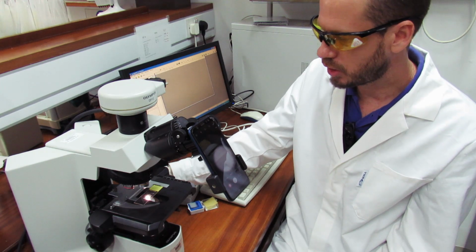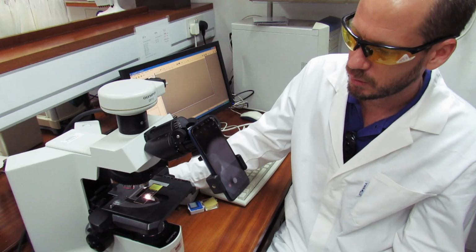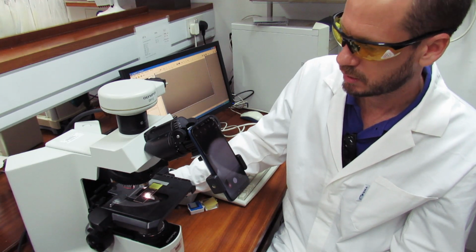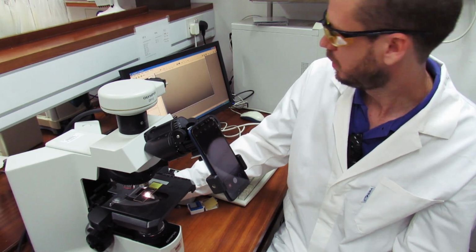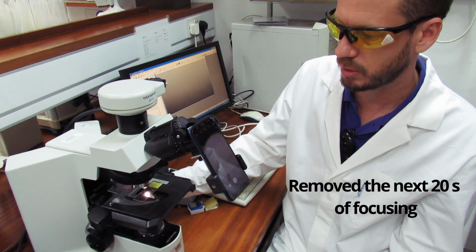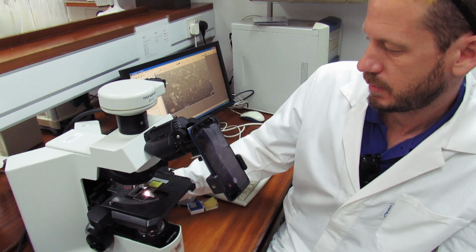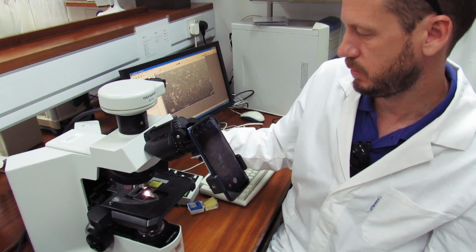So we start bringing that back up until you see that the image is coming into focus here on the screen. So let's continue doing this, bringing it up. This is easier done when you put your eyes on top of the microscope, not with the cell phone. There you go. Now we are focused with the 4 times.